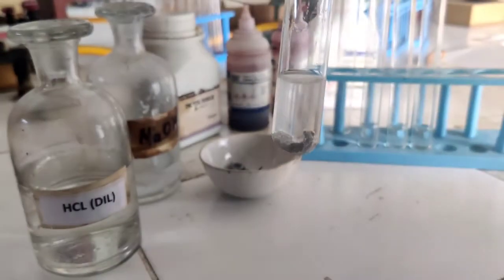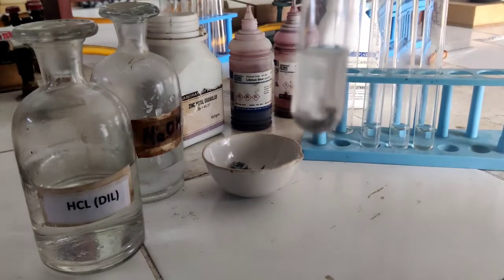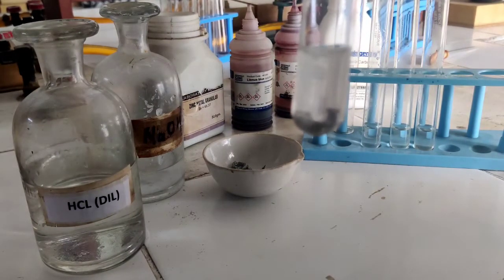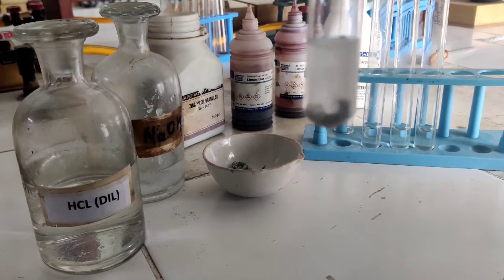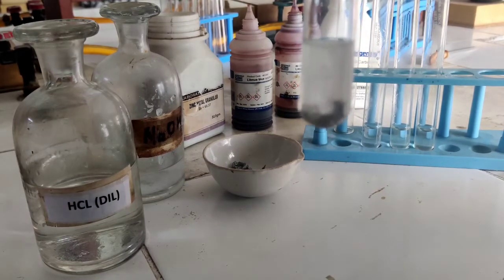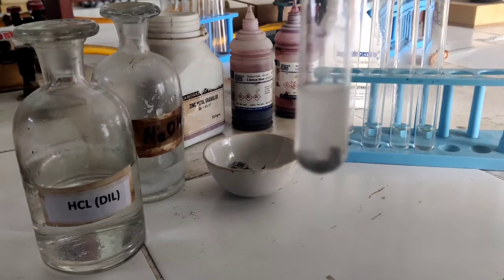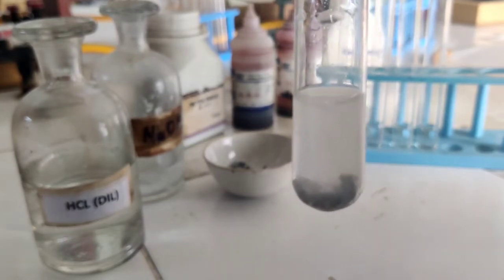This is Zn + HCl forming ZnCl₂, and hydrogen gas is released in this case. You can observe the bubbles which are formed inside this test tube — just see it carefully. These are the hydrogen gas bubbles which are formed in the test tube.